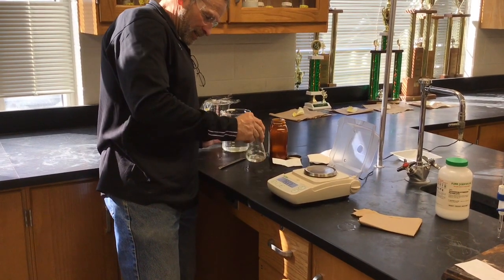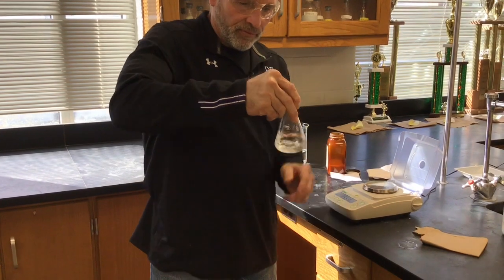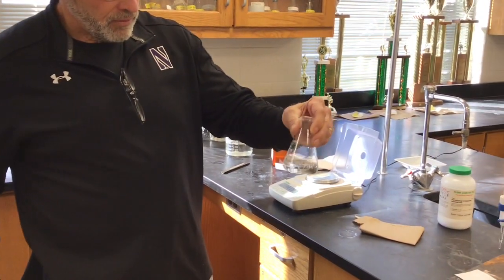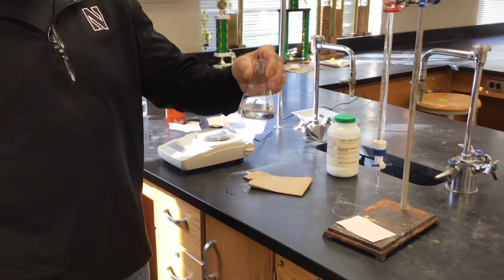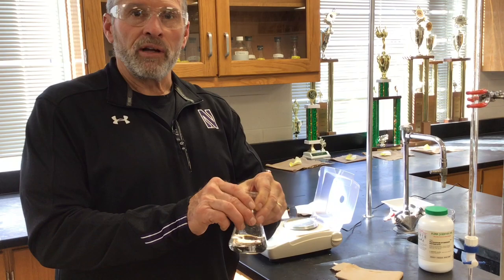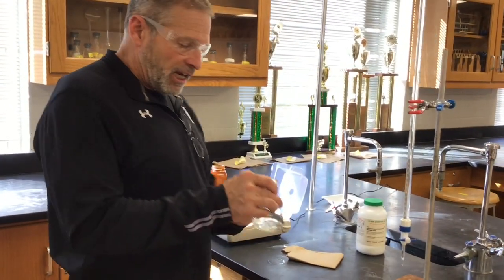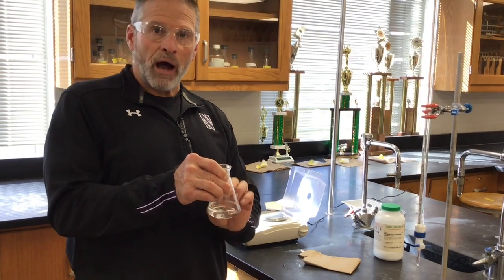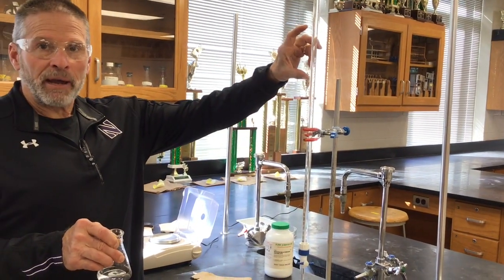Right. Okay, so same drill, right? We're going to dissolve the acid. We'll add the phenolphthalein to it and titrate. Now, what can be confusing is roles are reversed now. In part 1 of the lab, you recall, we used the KHP as the acid. We knew how many moles of acid were in here, and we were trying to standardize the base.